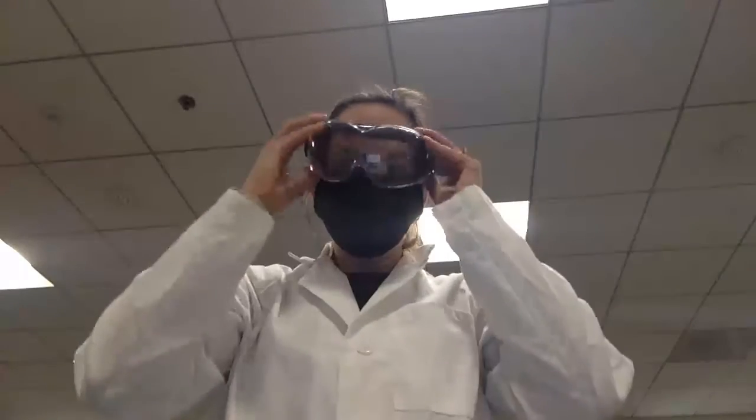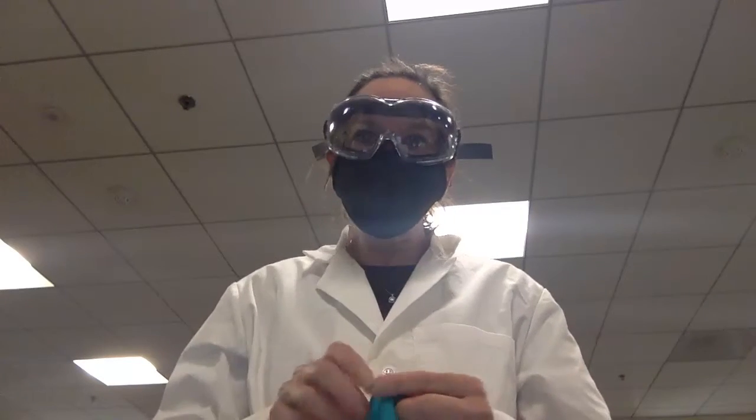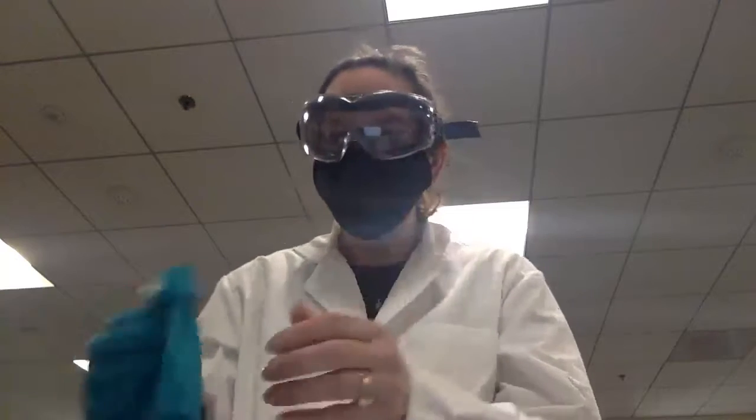As you can see, I'm in a laboratory. For good laboratory purposes, we wear a lab jacket. I will be wearing safety glasses as an important precaution, along with gloves. In addition to that, I have closed-toed shoes on, and I have long pants on, all protection for the skills that we have to do. And of course, I have a mask to protect me as a result from COVID.